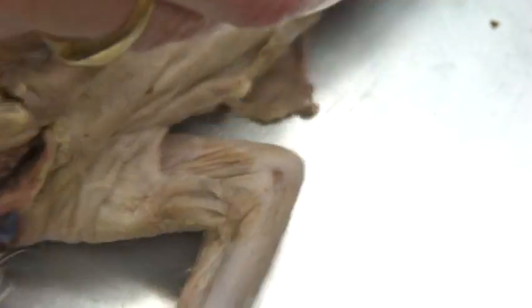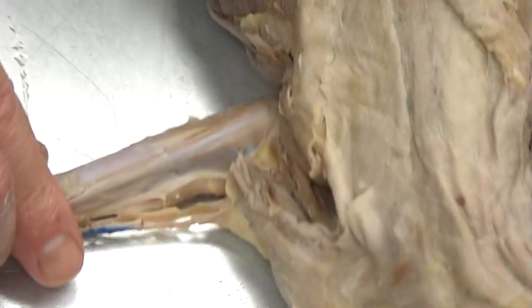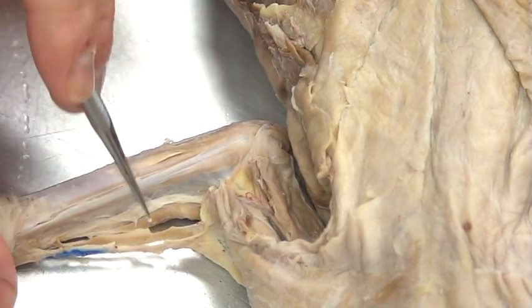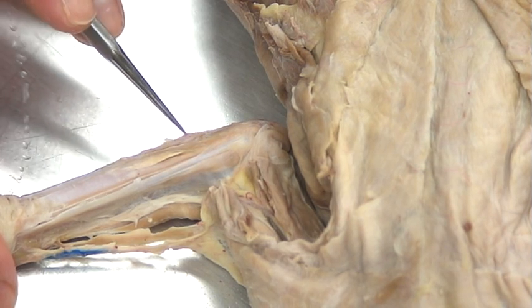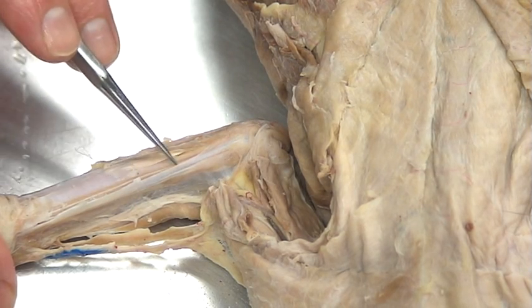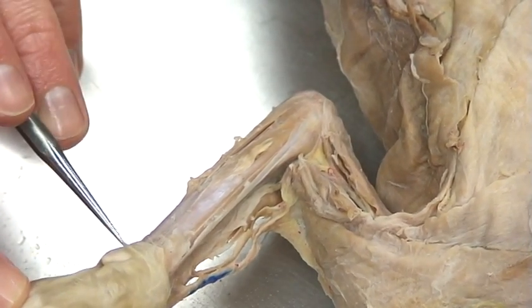If I flip to the medial aspect and look on the inside part of the arm — this is down on the ulnar side, and up here is the radial side. The two you need to know down here are the flexor carpi ulnaris, and then up here is going to be the palmaris longus. It leads right to the palm of the cat.